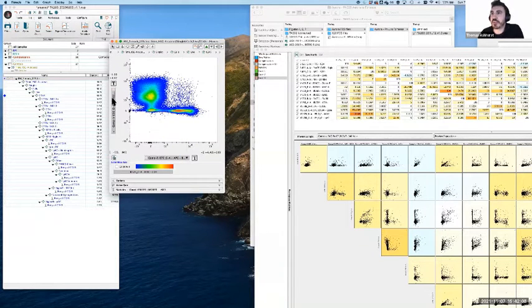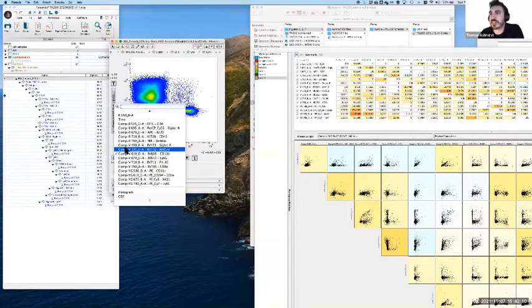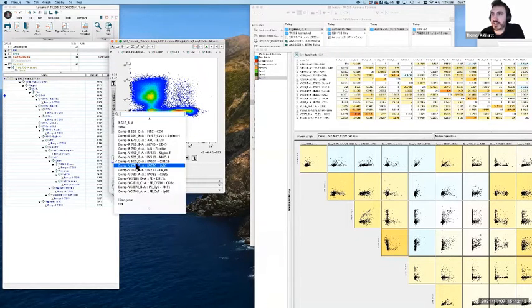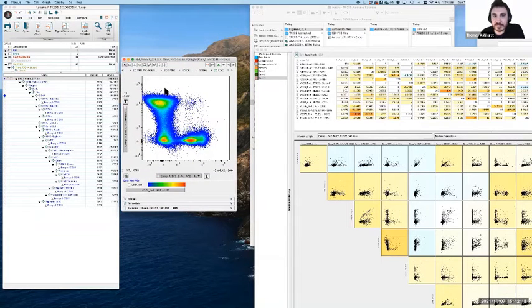We might end up in a situation where we have super negatives somewhere and we're trying to find where they are. Occasionally the answer we'll come to is that actually this is not overcompensation necessarily. This is simply spreading error. So these are in line or roughly in line. It probably is a tiny bit over, but this spread is just inherent to the data. That's a physics thing which we can't necessarily change. So in this case, it is creating a slight amount of super negatives down this direction, but it's really not anything that we're going to correct mathematically. That's just inherent to the data now.